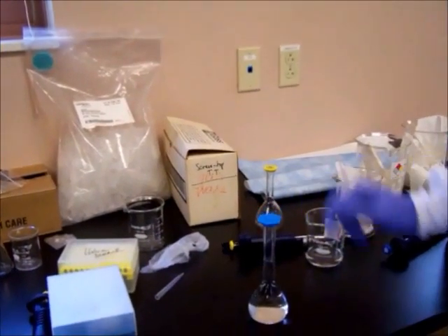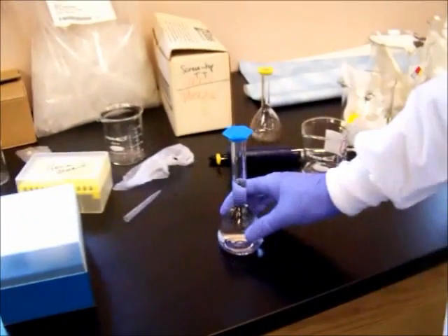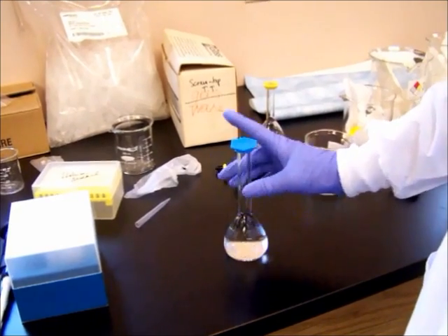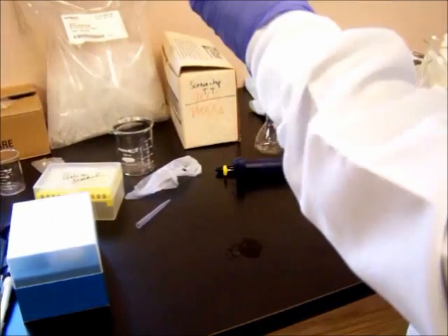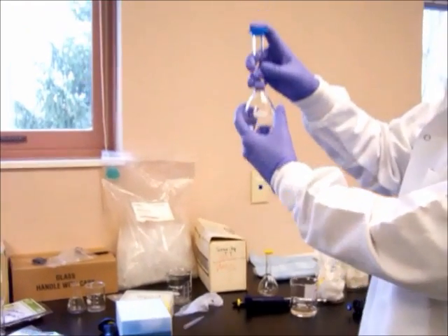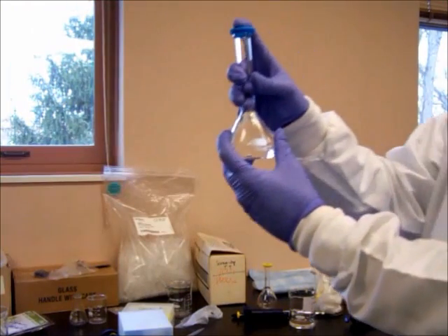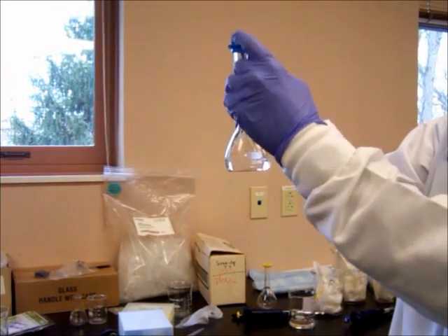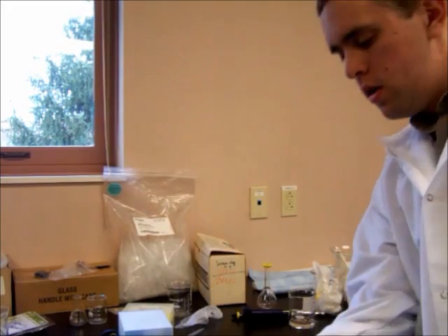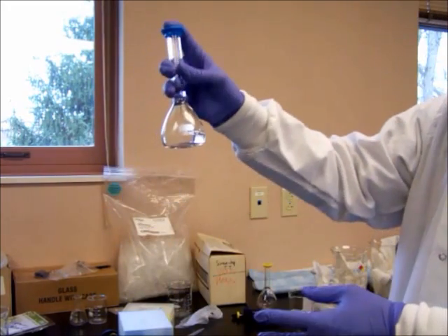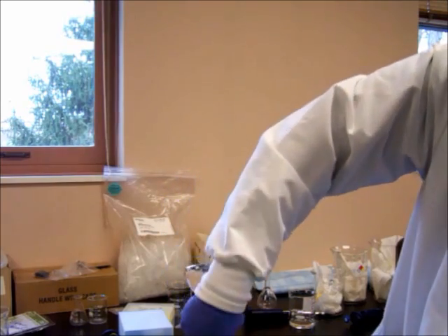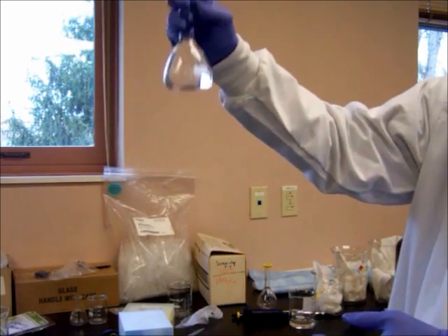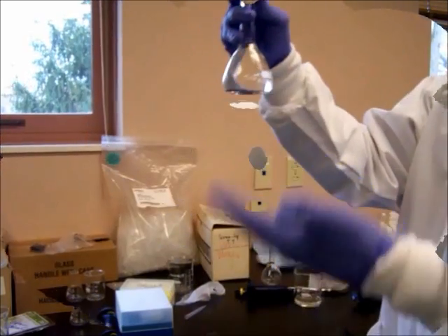Next, put the cap on. You want to make sure that your compounds inside are well dissolved. So making sure that you have a secure, solid fit, only do this if you have a secure fit on top. Turn the volumetric flask upside down approximately ten times. Okay, so that was ten times.